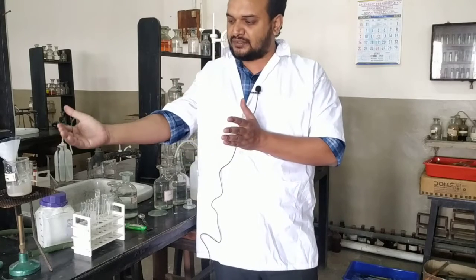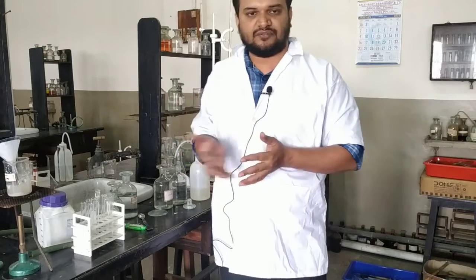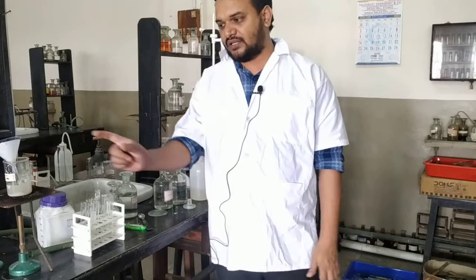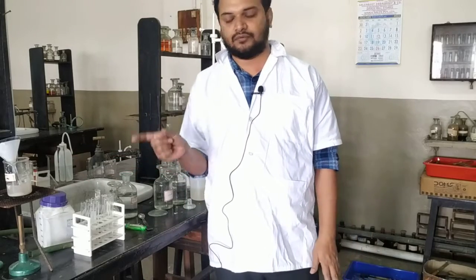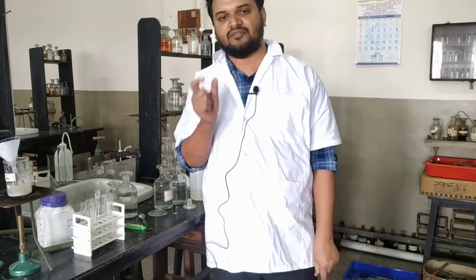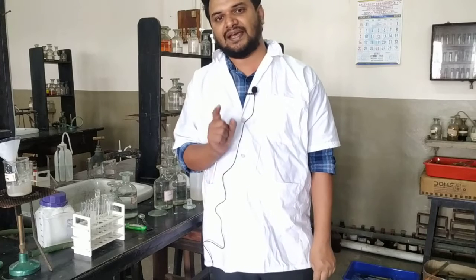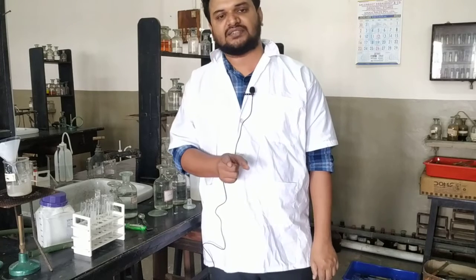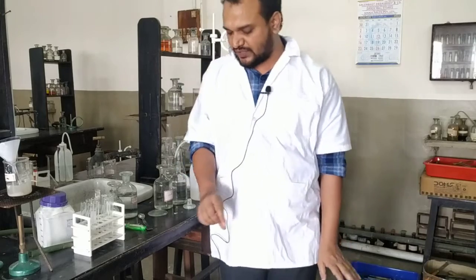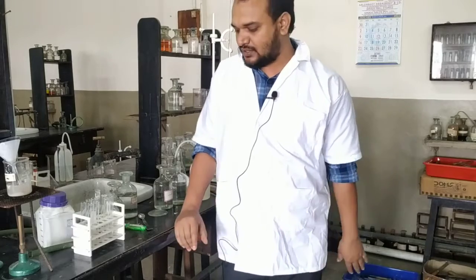Then you take the sodium carbonate extract and do the confirmatory test for sulfate, and then only you say yes, sulfate is present and confirmed. What is the confirmatory test? First neutralize the sodium carbonate extract, add barium chloride, a thick heavy white precipitate is obtained. That precipitate is insoluble in excess dilute HNO3 or excess dilute HCl. Now sulfate is confirmed. So given cation Zn2+, given anion SO4 2-, so the salt given is zinc sulfate. That's all for the salt analysis.